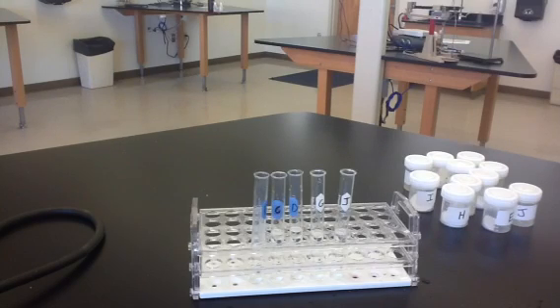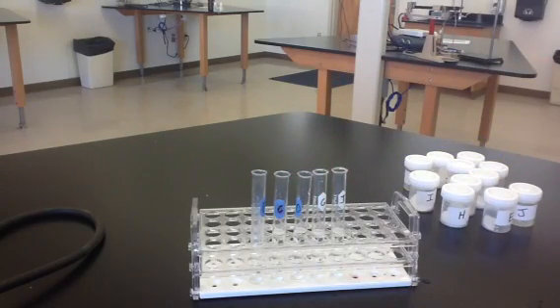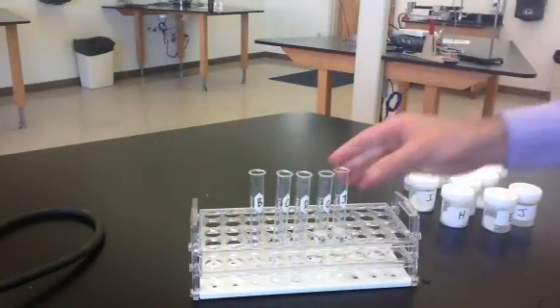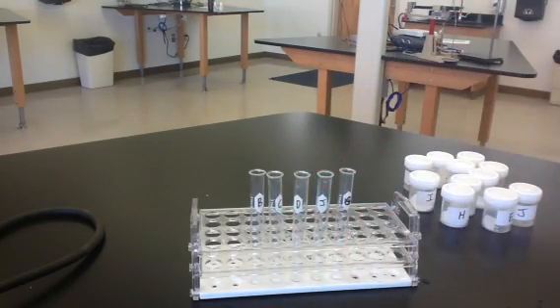The next test is going to be the test with the Benedict solution. Okay, so we're going to get new samples of solutions B, C, and D. So there's new samples of B, C, and D. We'll also replace the G and the J. So these are just fresh samples of the substances that are still to be identified.